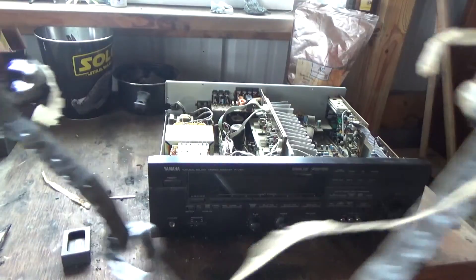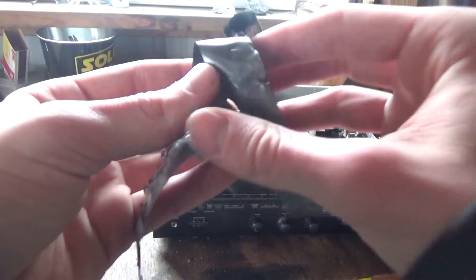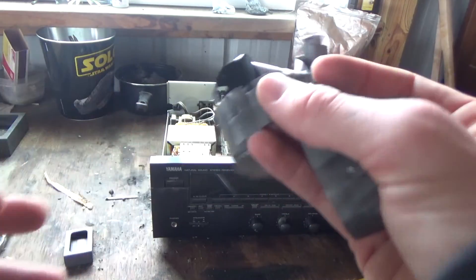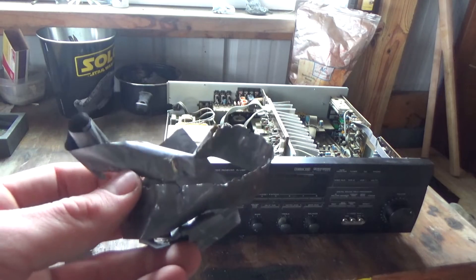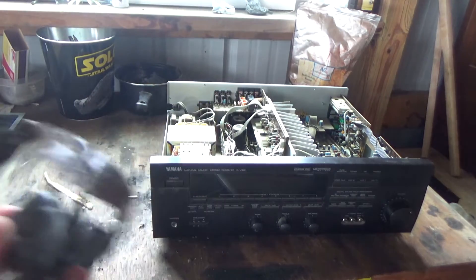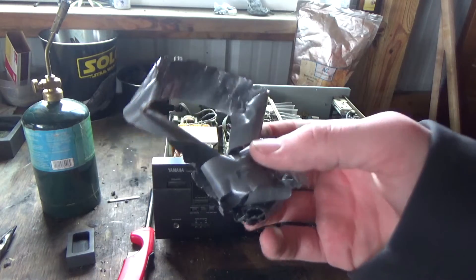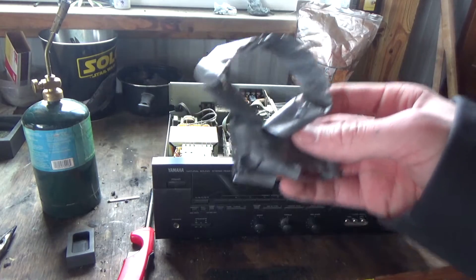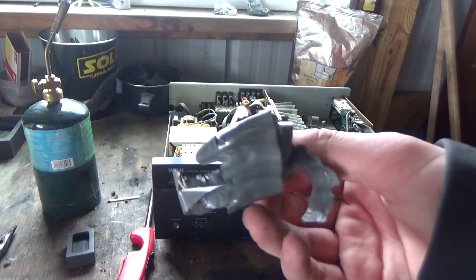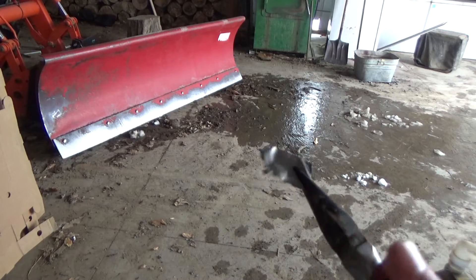I don't know if this is tantalum metal or not, but let's take it off and find out. It's a foil-type material. If this is actually tantalum, it won't melt with my blowtorch — so let's go try that out. Another way to test it: put it into a strong acid like muriatic acid; if it dissolves, it's not tantalum, but if it doesn't dissolve, that's another indicator that it is tantalum.